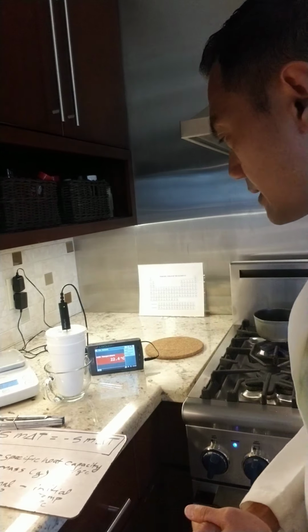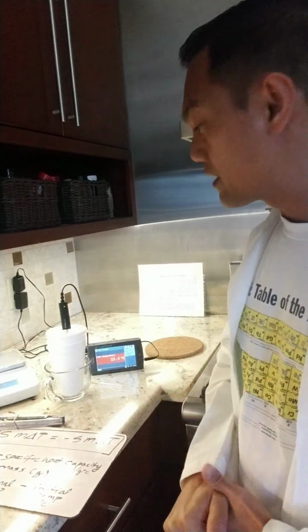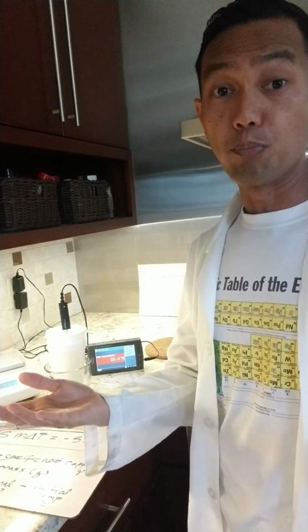All right, it looks like another 30 seconds, 22.4. So there's a slight decrease, but what we'll have to watch out for is whether there's fluctuation or if it's going to be consistent. And if it's consistent for a couple of minutes, then we can pause right there.